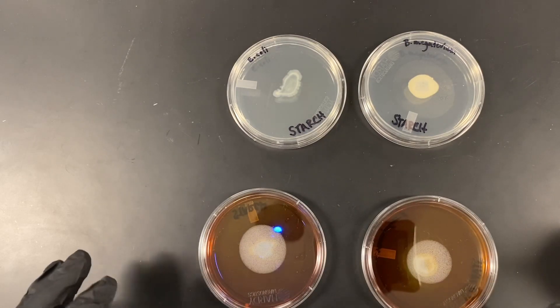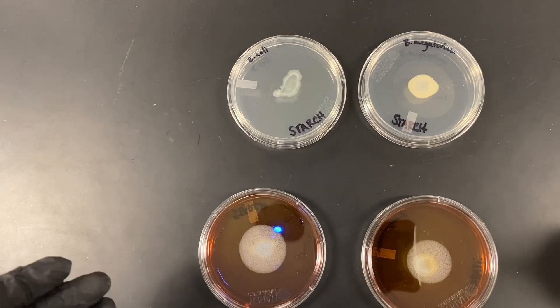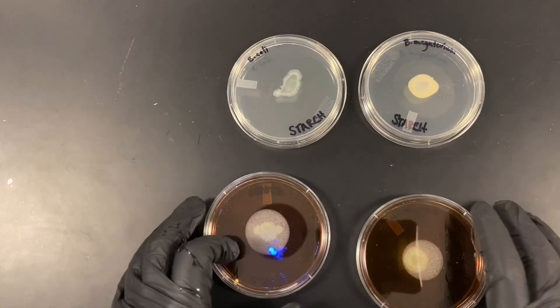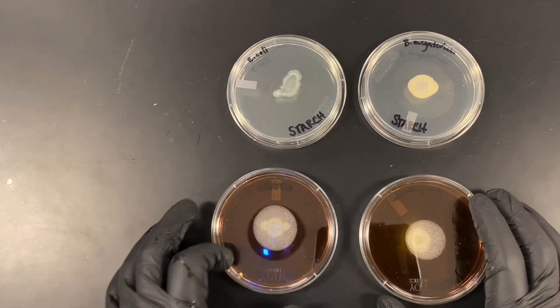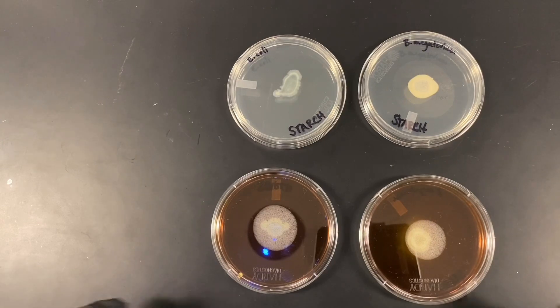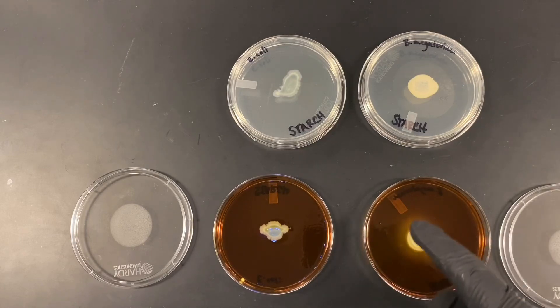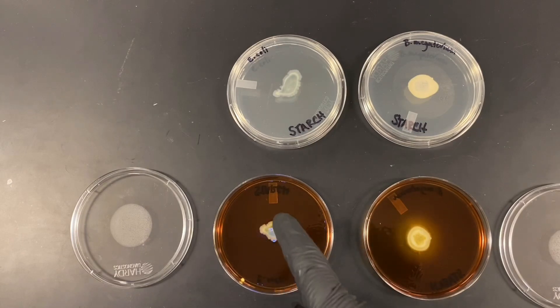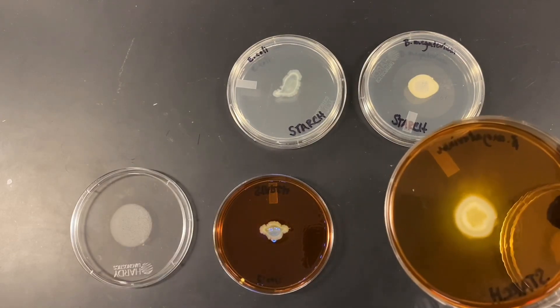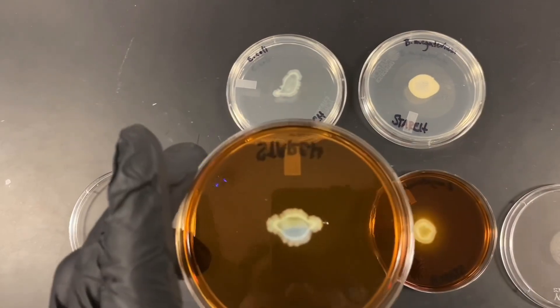Continuing with lab 21 — after allowing some time to pass, we're looking for the absence of amylose or starch. We look at the plate from the bottom or from a distance, searching for a zone of clearance around some colony growth. Looking up closer, we can see a lighter color around the rim of certain colonies, indicating starch consumption, versus colonies that show no such clearance.